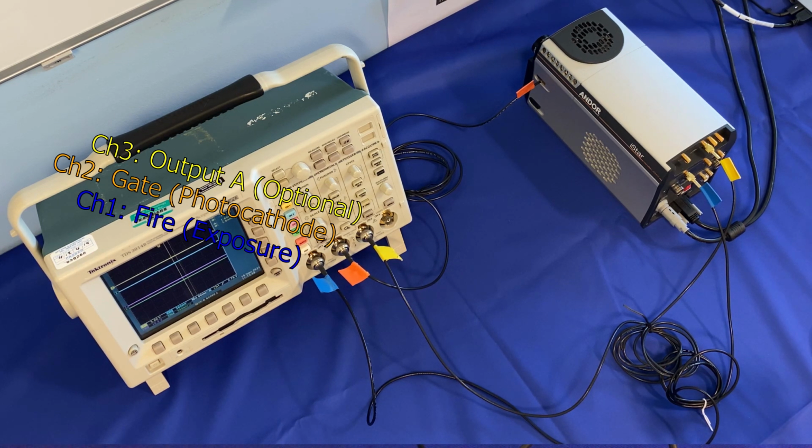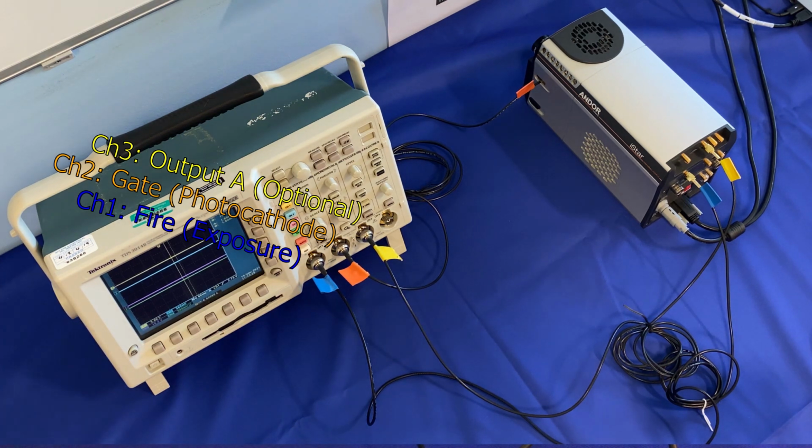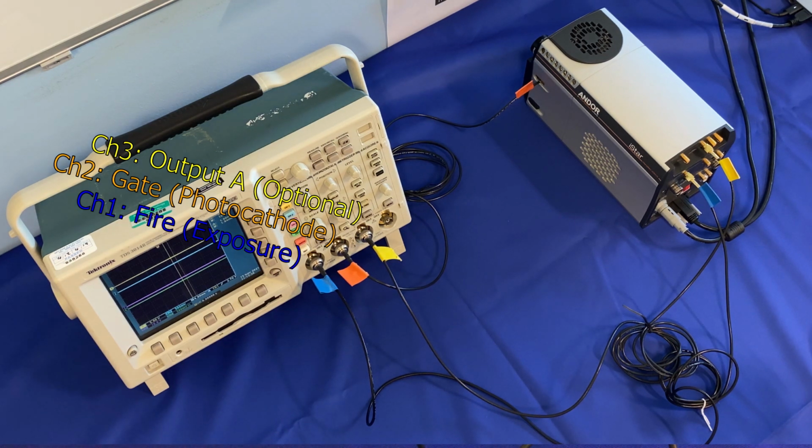And secondly, you can see in orange we've attached to the front of our iStar sCMOS a cable into the gate monitor. This effectively allows us to directly monitor the gating of the photocathode. This is typically hidden behind a grommet on the camera. So this is actually an AC coupled setup, and what effectively is happening within your intensifier is there's a wire wrapped around the photocathode, and this is able to pick up pulses from the gate, and this gives us some temporal information about where the gating is occurring, and we can then look at this in relation to our fire pulse and other outputs in the oscilloscope.